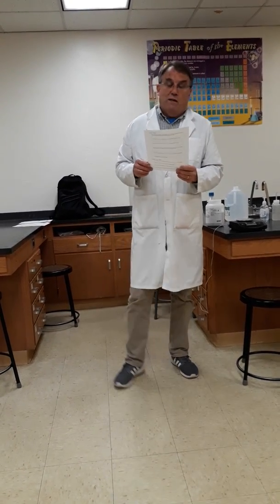So, if you read along, it says that chemists find it useful to know how many moles of a substance are present in a given amount of solution. This information makes it possible to calculate the number of moles available for a chemical reaction by just measuring the volume of solution used. So as you know by now, moles are paramount. If we know the moles of chemical that's available to work in a chemical reaction, we can make predictions. And that's the essence of this lab.